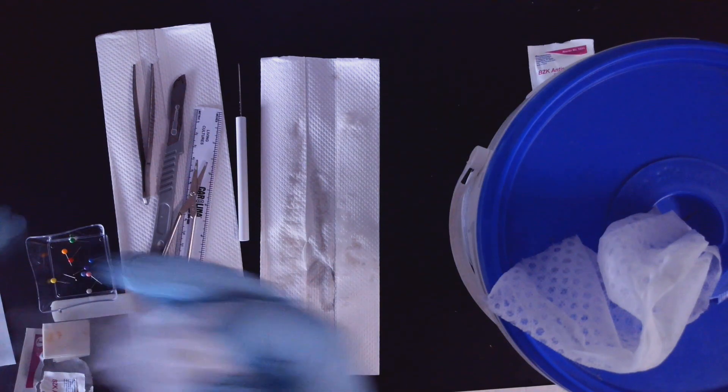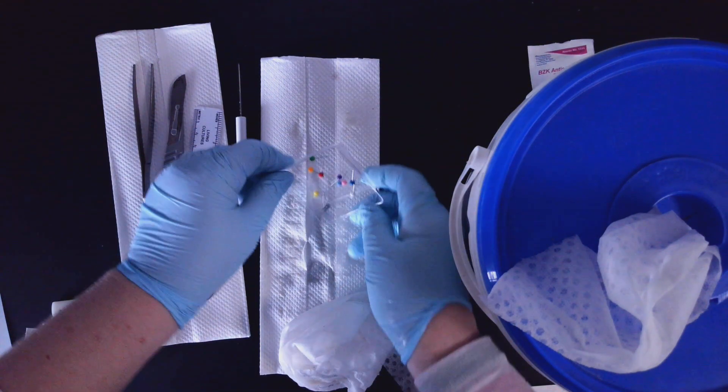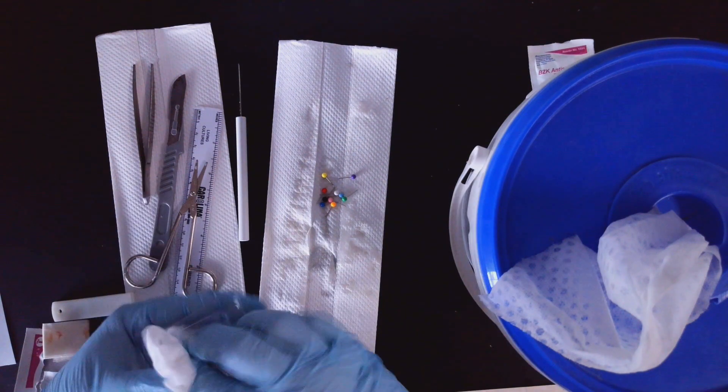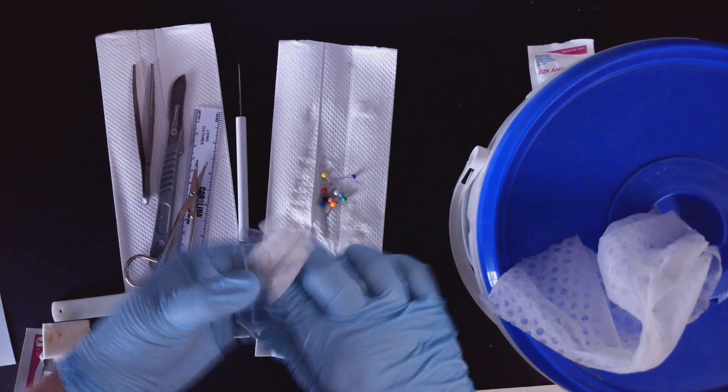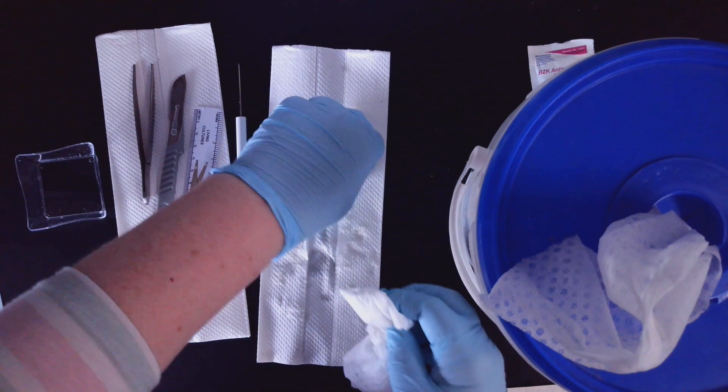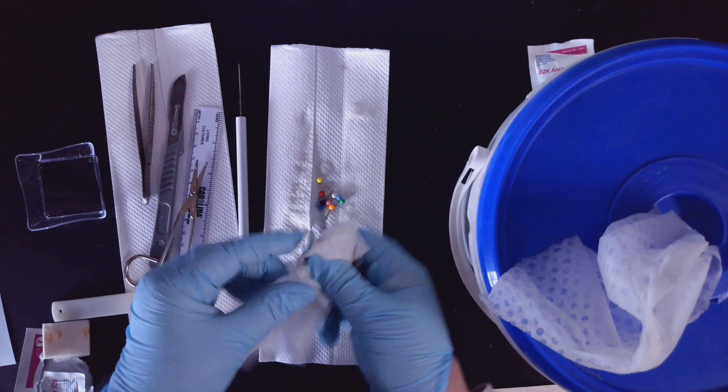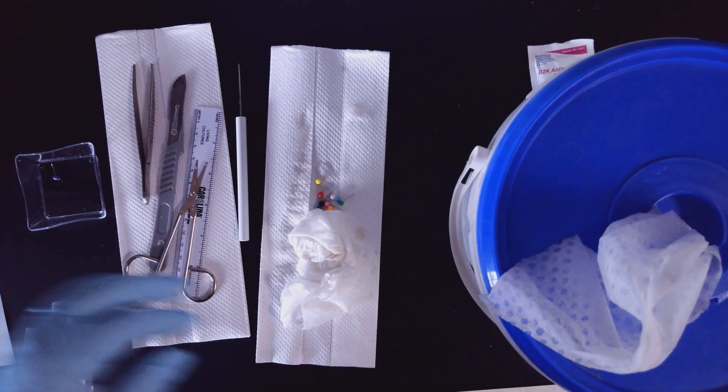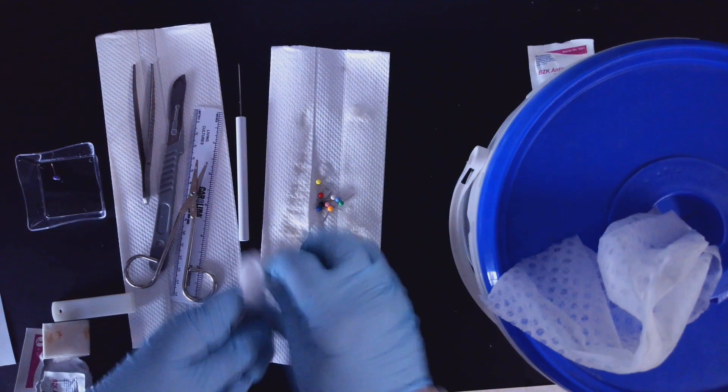And then you need to do the same thing. So I'm going to dump these out. I'm going to wipe the inside of this little container and then I'm going to just wipe off each of the individual pins.